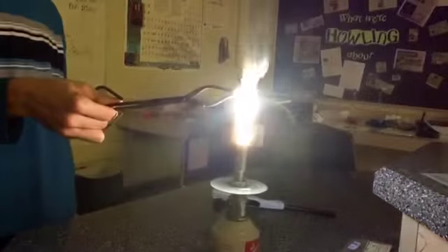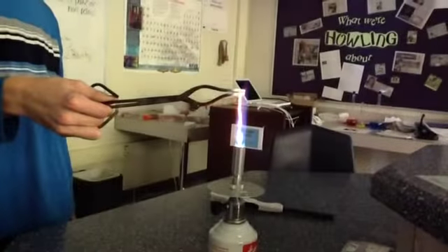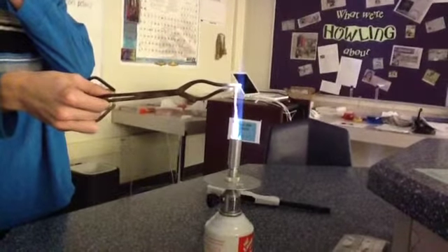The heat is adding oxygen to the magnesium. The bright light seen here is the reaction of magnesium and oxygen. Then, the magnesium oxide becomes brittle and falls apart.